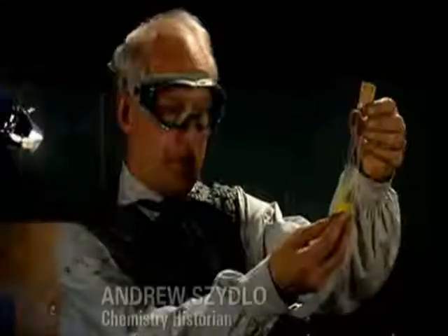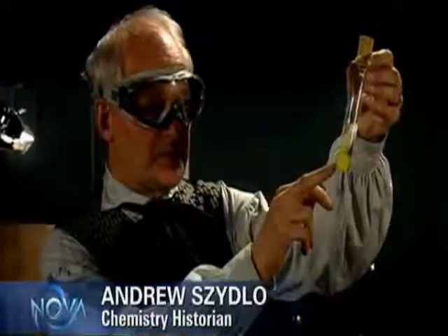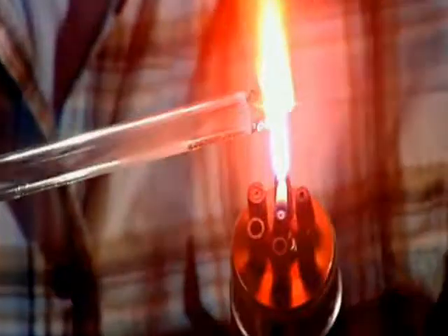We are about to undertake an exceedingly dangerous experiment in which Michael Faraday, in 1823, heated this substance here, the hydrate of chlorine, in a sealed tube. Is that sealed? That's sealed, Andrew. That's absolutely brilliant.